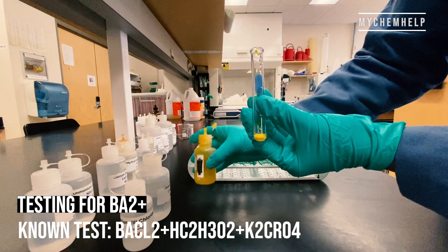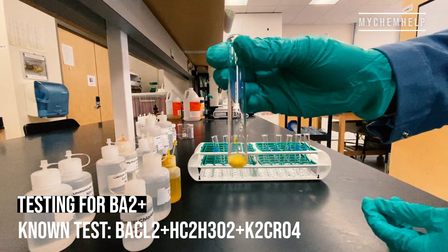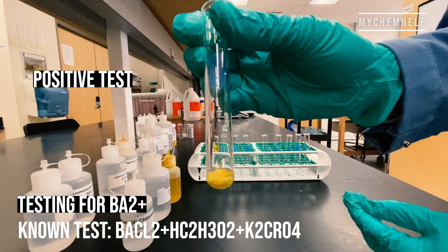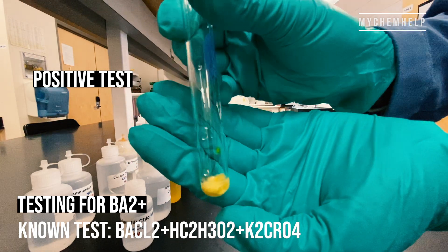This one's my personal favorite — that yellow precipitate signifies a positive test.